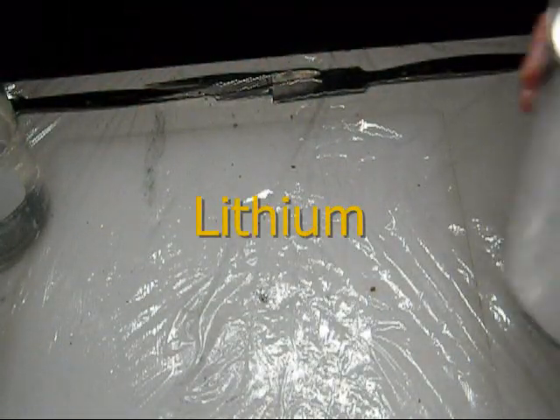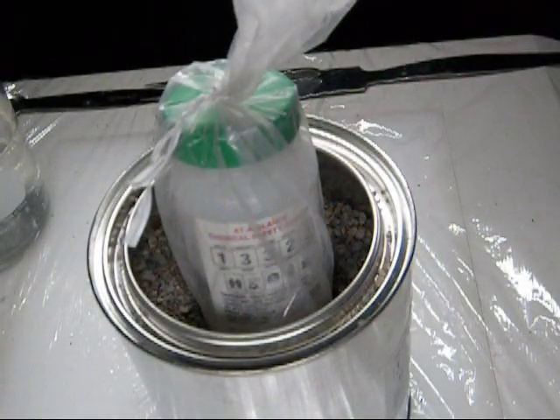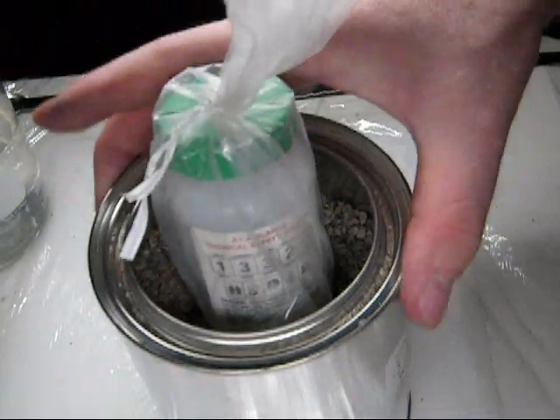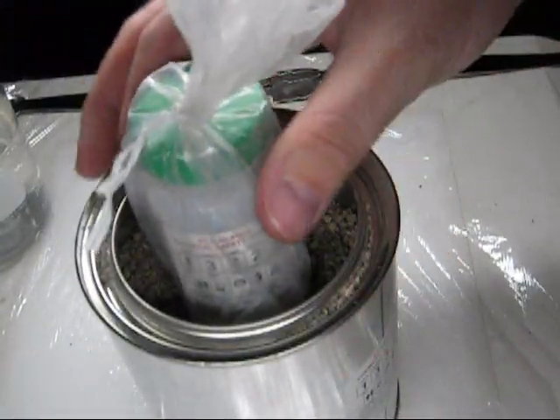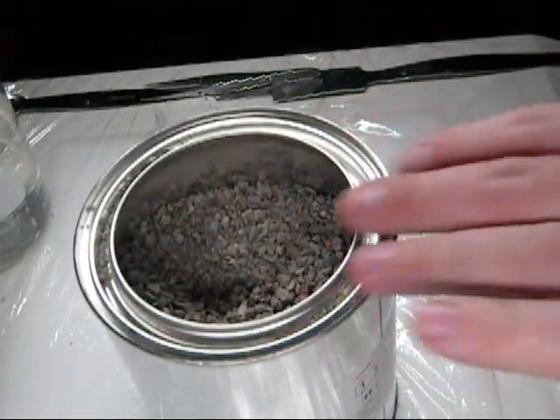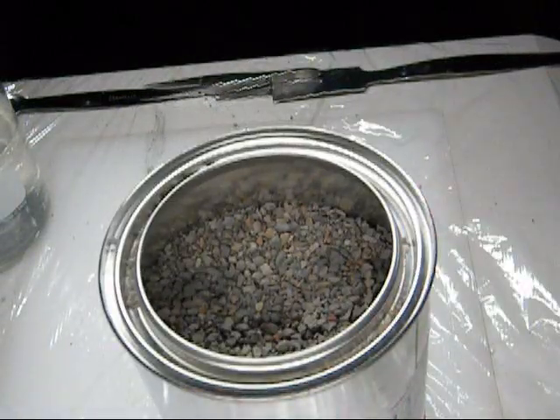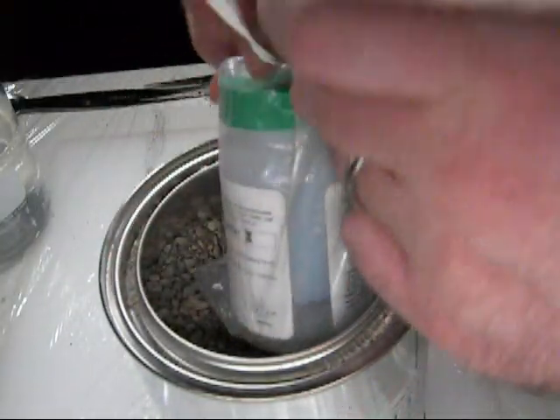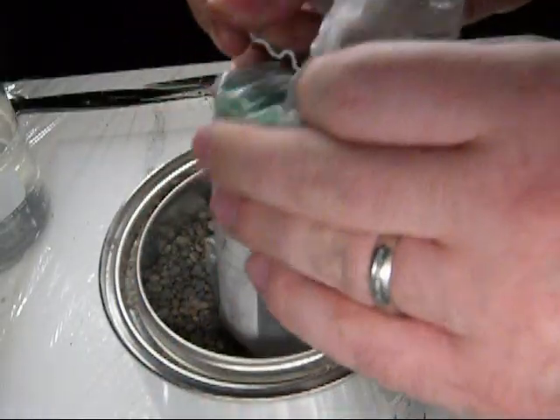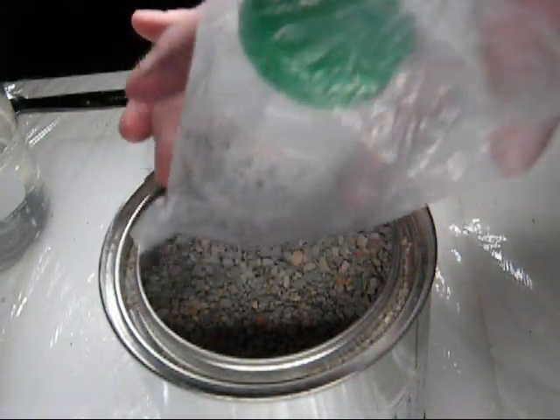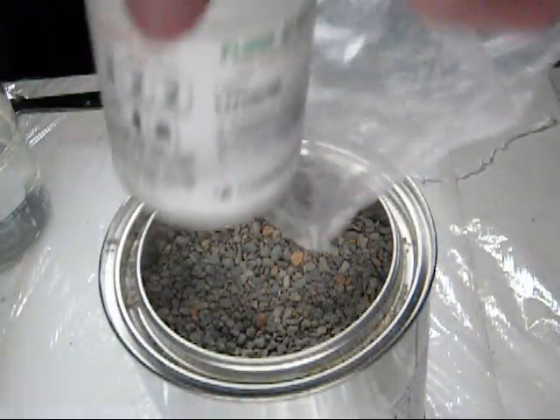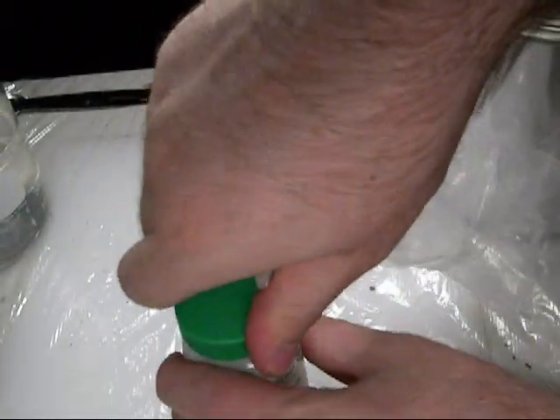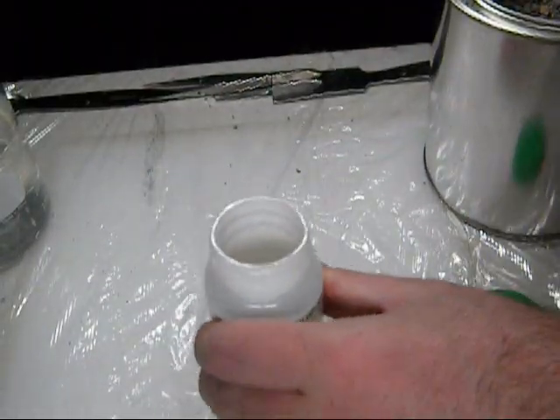Anyway, our next one is lithium. And I'd like you to see how lithium is stored, and I'll just point out that all of the others are stored like this. All the rest ones. Lithium, sodium, potassium. But I have them stored here in a metal can, and then inside that metal can is a whole bunch of kitty litter. And that's to keep moisture from getting in there. Inside there, then, is a plastic bag, and that's twist-tied shut. And inside there is a bottle.